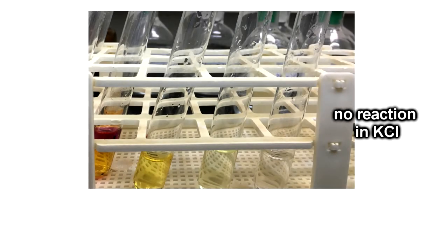In the first row of the test tubes, we can see that reactions occur in the mixtures of chlorine water with potassium bromide and potassium iodide, but no reaction occurs in the potassium chloride solution. When the chlorine water reacts with potassium bromide, the color of the solution changes from colorless to yellow.